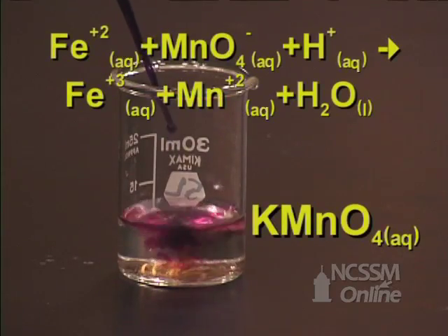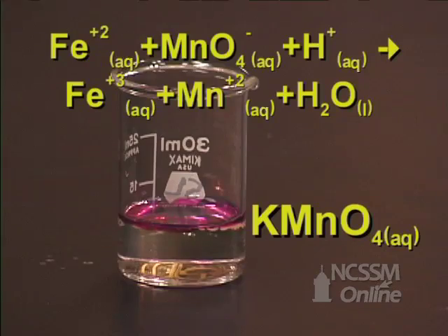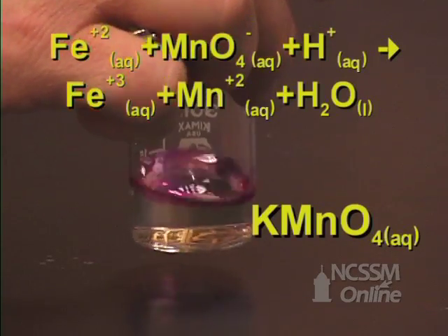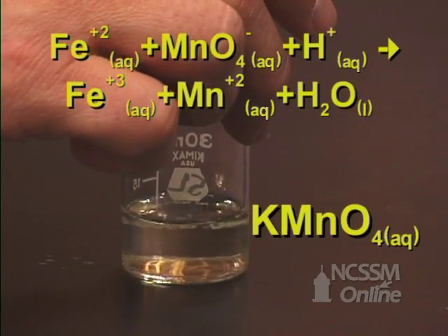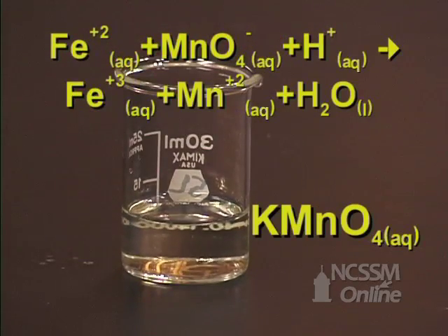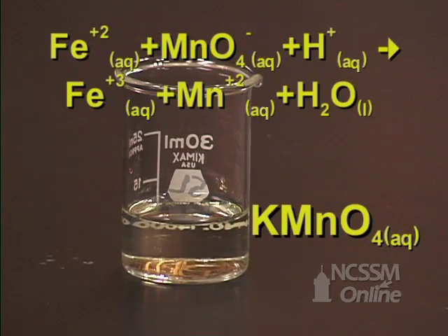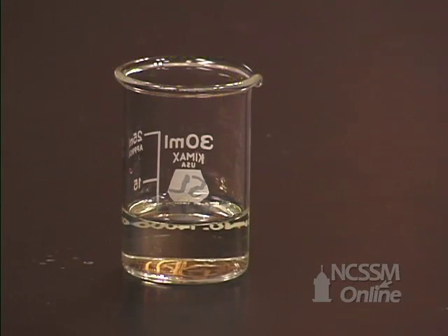The potassium permanganate color disappears very rapidly. The reaction between the iron plus 2 ion and the permanganate is a rapid reaction. Ionic reactions in solution tend to be rapid.